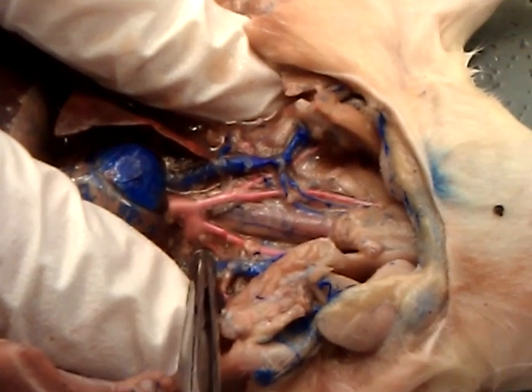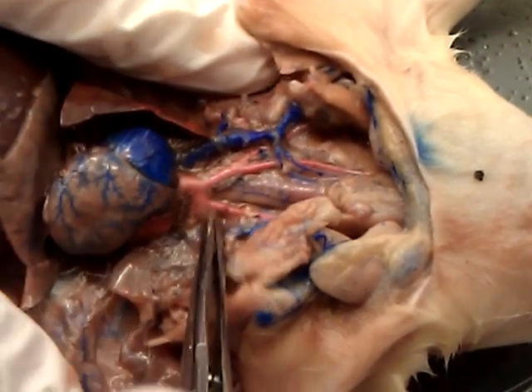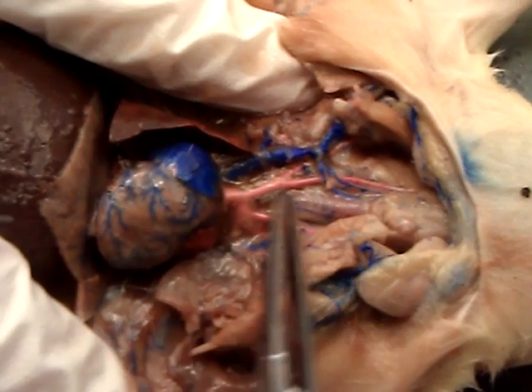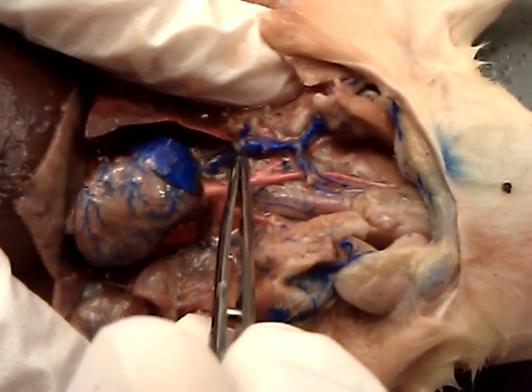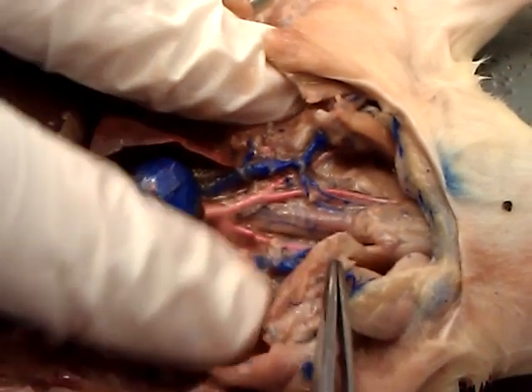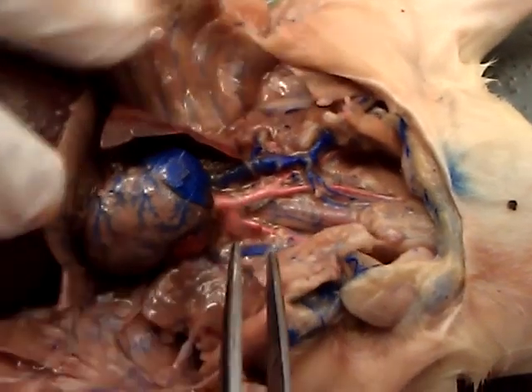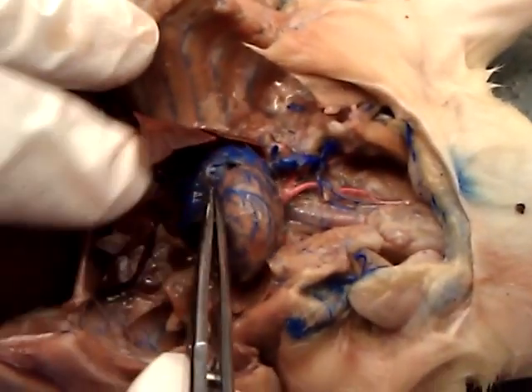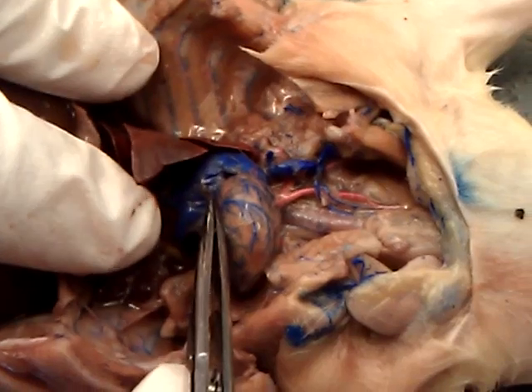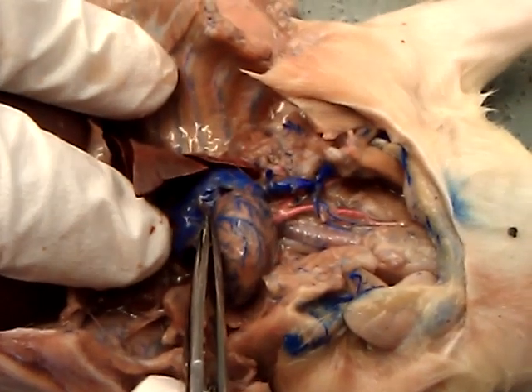And left subclavian all the way right here. This is the heart. This is the superior vena cava — there's two of them — and under the heart we have an inferior vena cava.